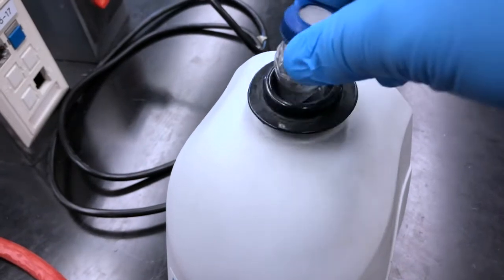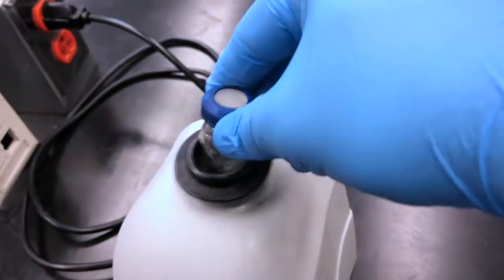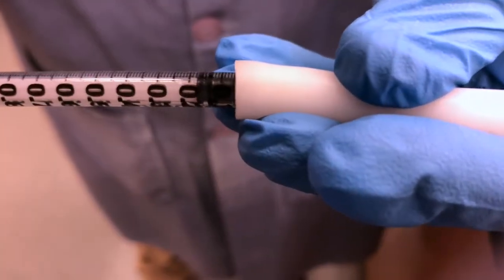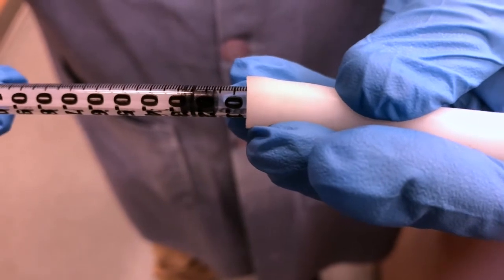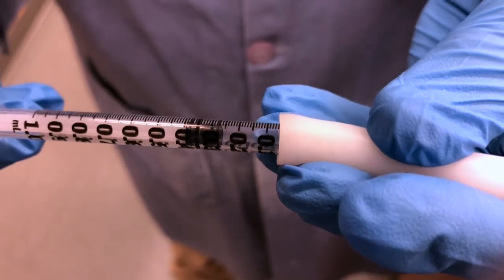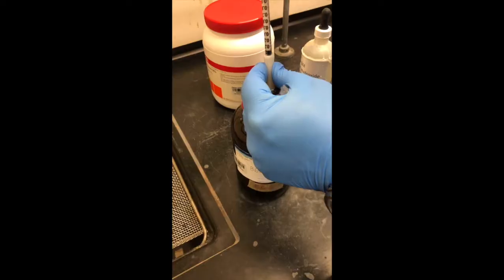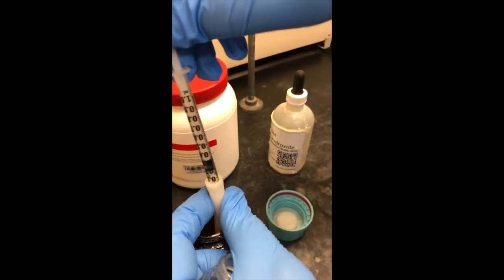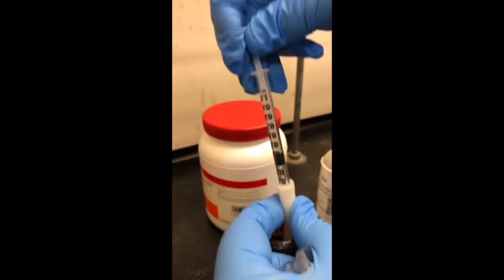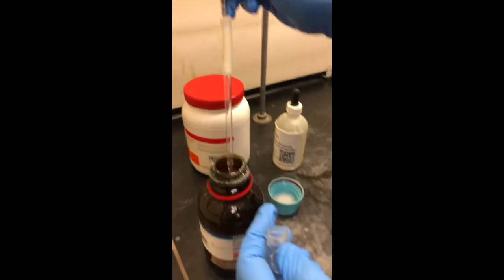To finish dissolving, we can put it on the shaker here. This will agitate the mixture without us having to shake it and turn it upside down. And then we're ready to add the benzoyl chloride. Again, with a syringe pipette, a fresh syringe, we're going to add 0.26 milliliters of benzoyl chloride, being careful not to over add it. Benzoyl chloride will be in slight excess, but if it's in too large of excess, we know that we get some unwanted impurities from the excess benzoyl chloride reacting in the aqueous solution.